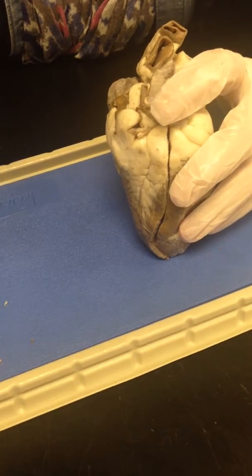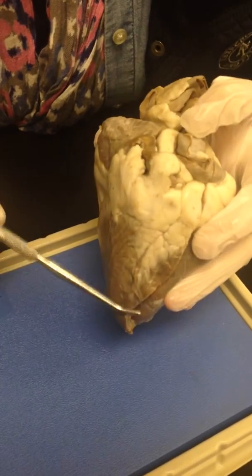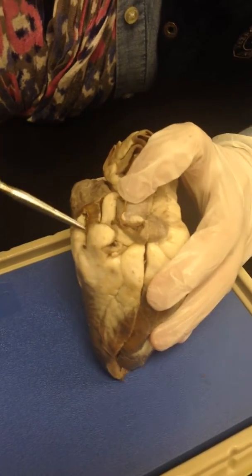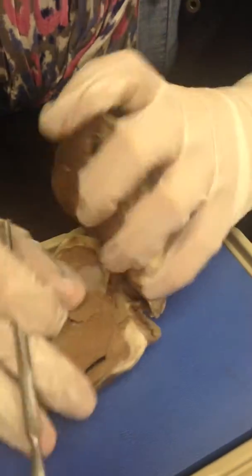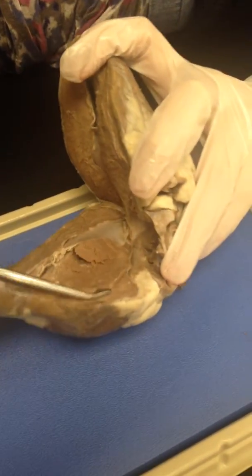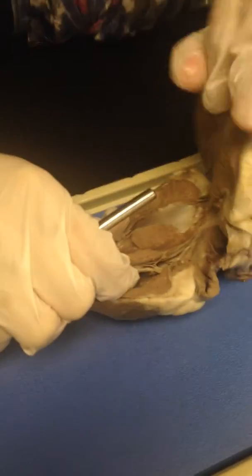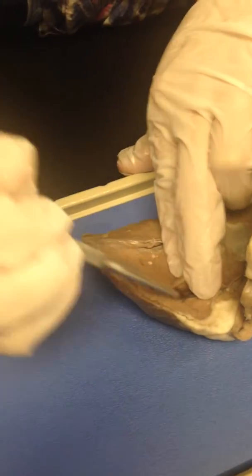So blood will come from the body and it will enter the vena cava. This will be the inferior side, and if it were not cut off, it would go all the way down. And the superior side. From the superior side and inferior side, the blood will go inside, straight to the right atrium. Right here, this is the right atrium. And again, if we open it there, you can see the tricuspid valve. The blood will go straight through the atrium to the tricuspid valve and inside the right ventricle.